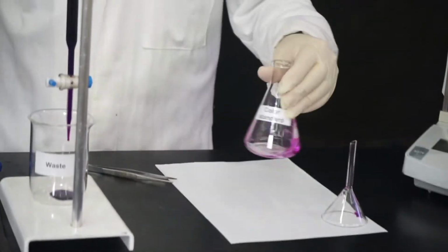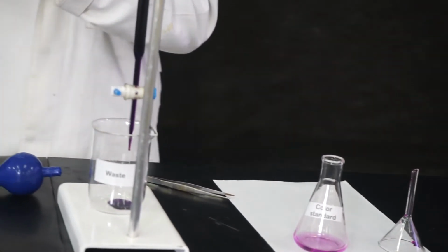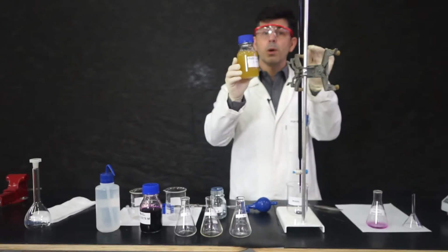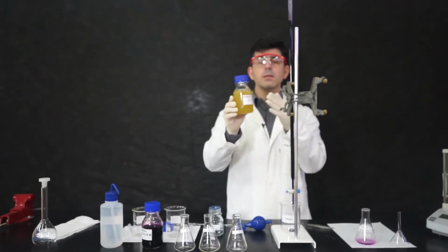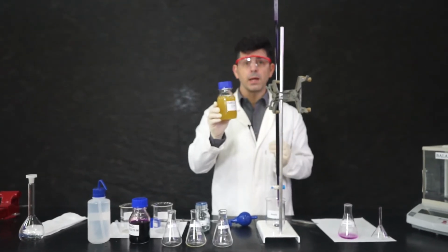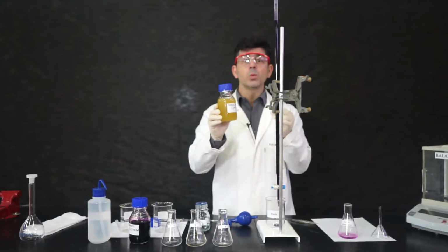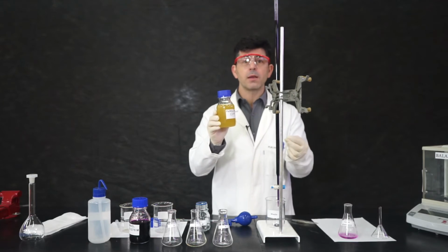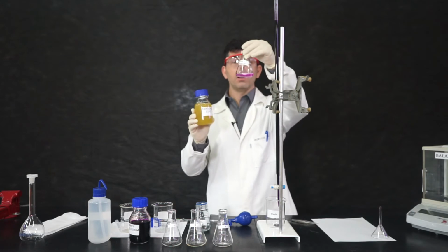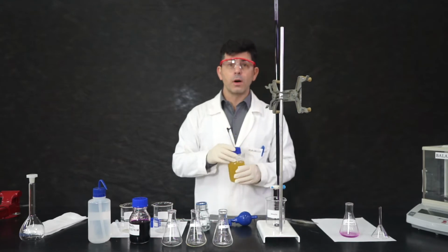When you do this, we get the color. So let's understand. The iron is yellowish. Potassium permanganate is purple. As potassium oxidizes the iron, the oxidation will discolor the permanganate. The moment I reach the end point, then if I add 1 extra drop of potassium permanganate, I'll be in excess. And then we will see this color. This is when we have to stop the titration and annotate the volume.